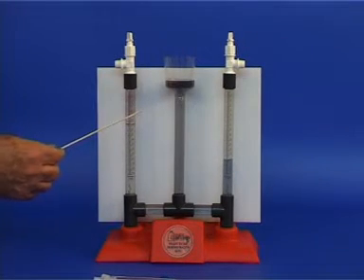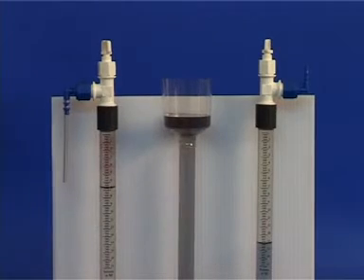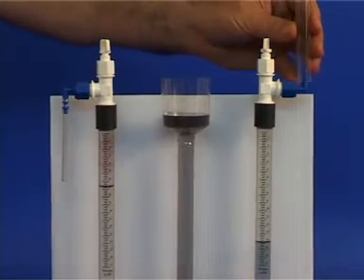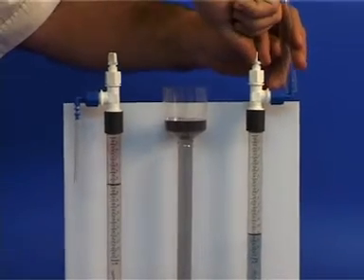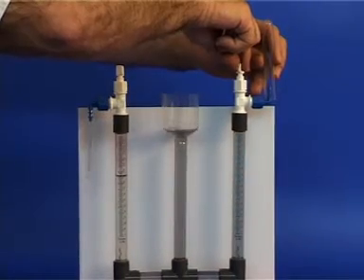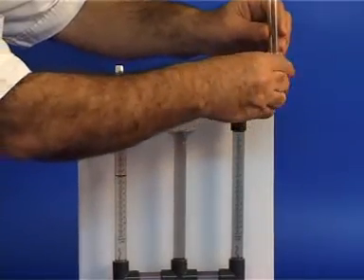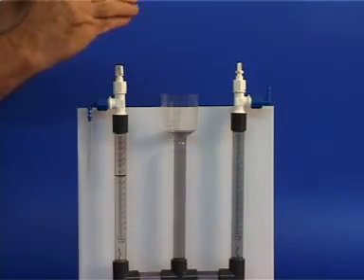Now you will collect the two gases. To collect the hydrogen, you will use a smaller connector. Direct its outlet upward. Watch the level of the liquid rise. Close the test tube and put it aside.